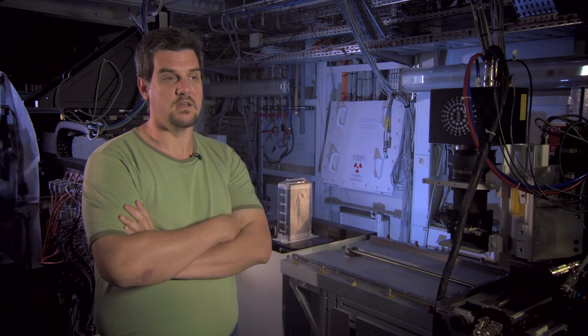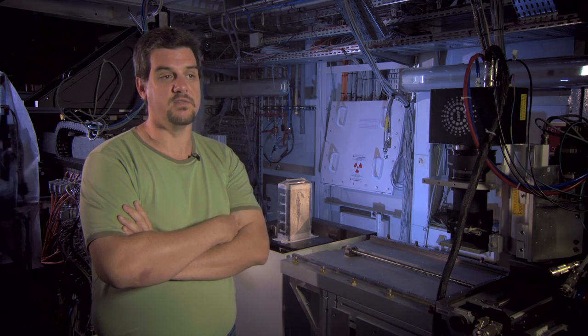The first fossil was scanned here at the end of 2000, and it was so successful that we never stopped. Paleontology has become one of the most important scientific topics for the beamline we use — the ID19 beamline.